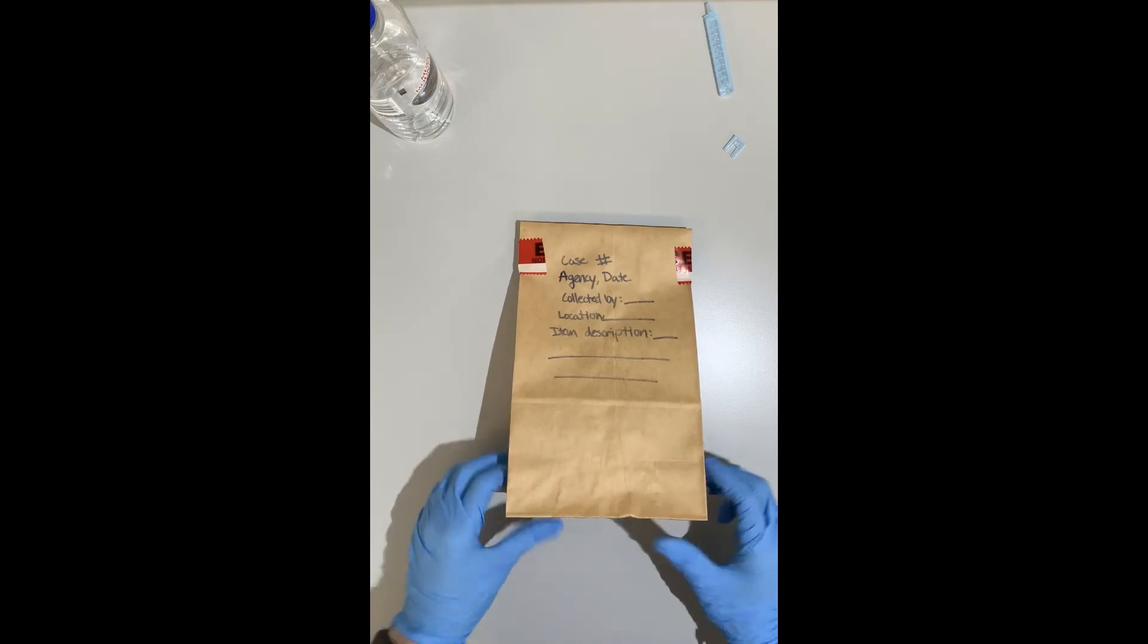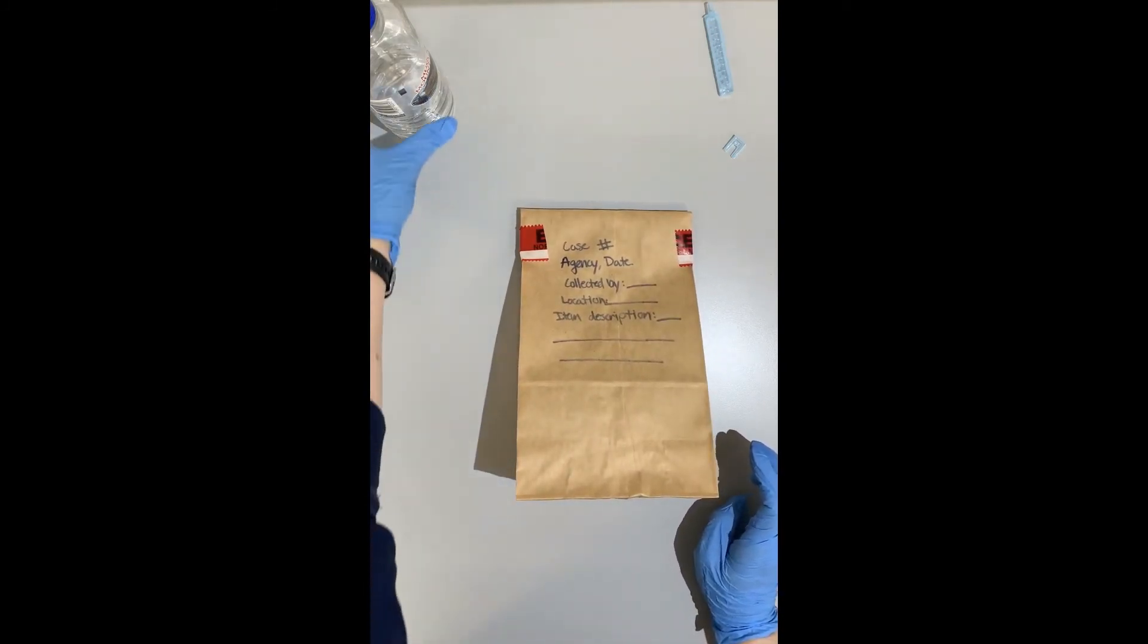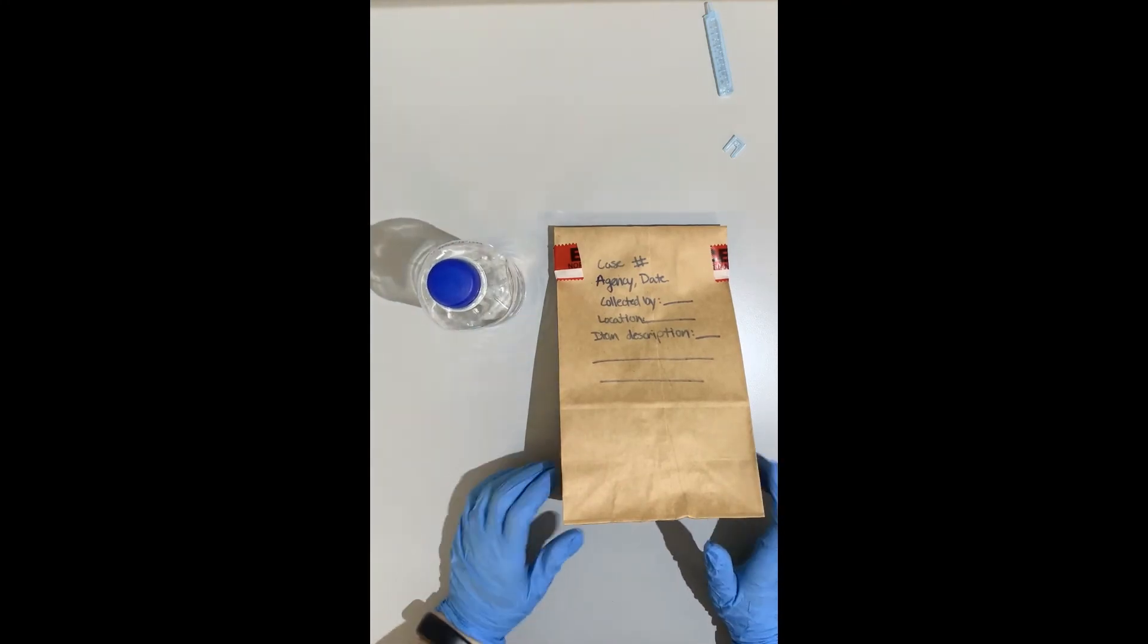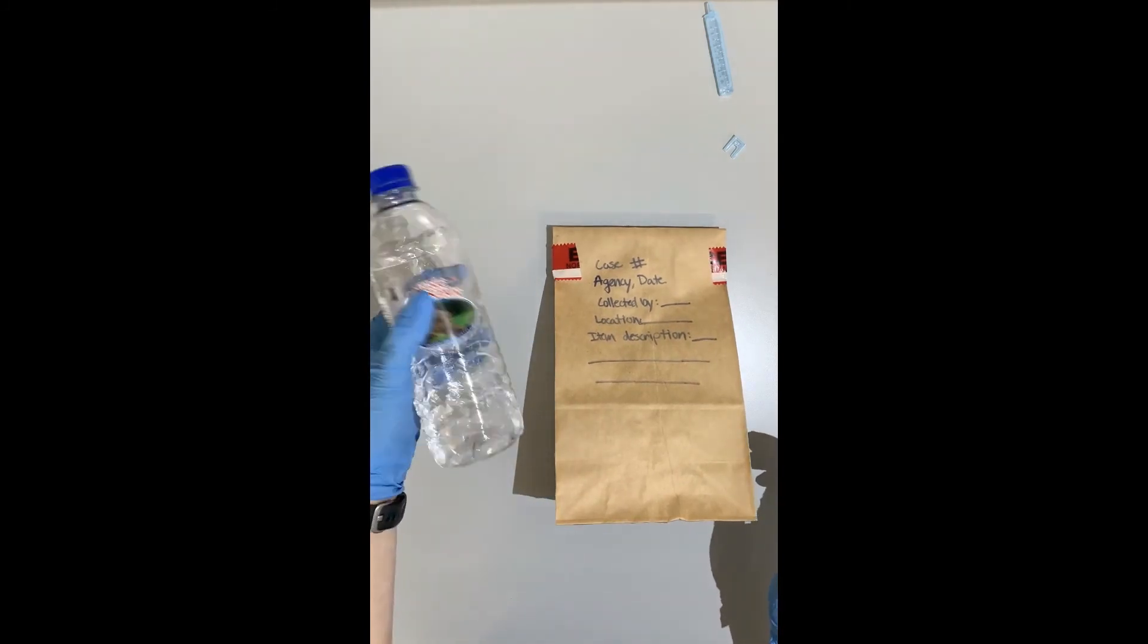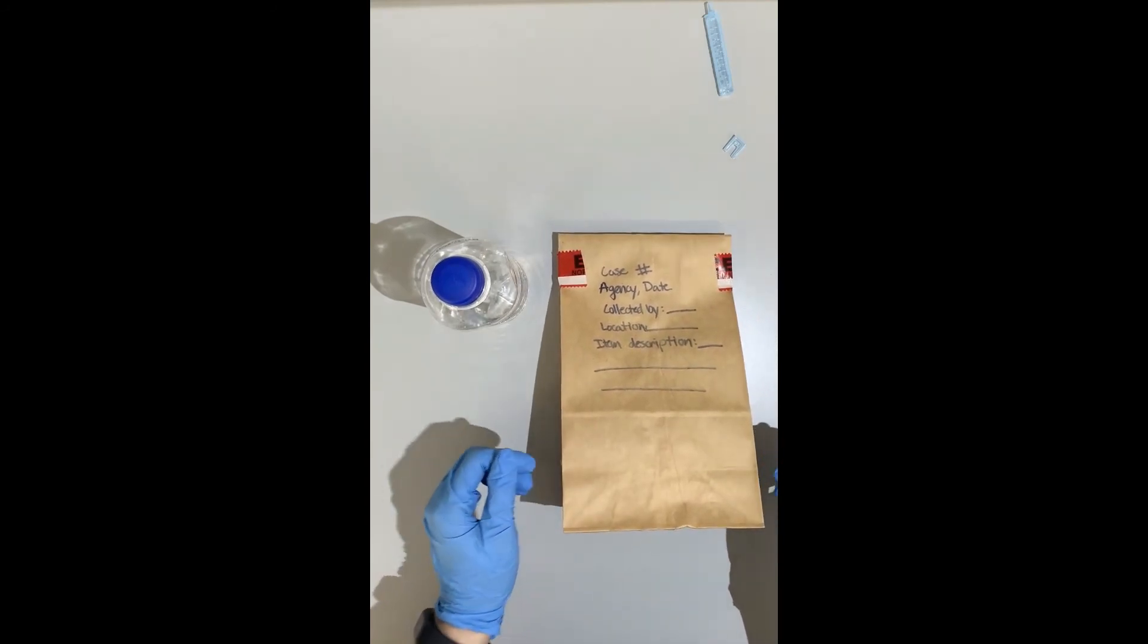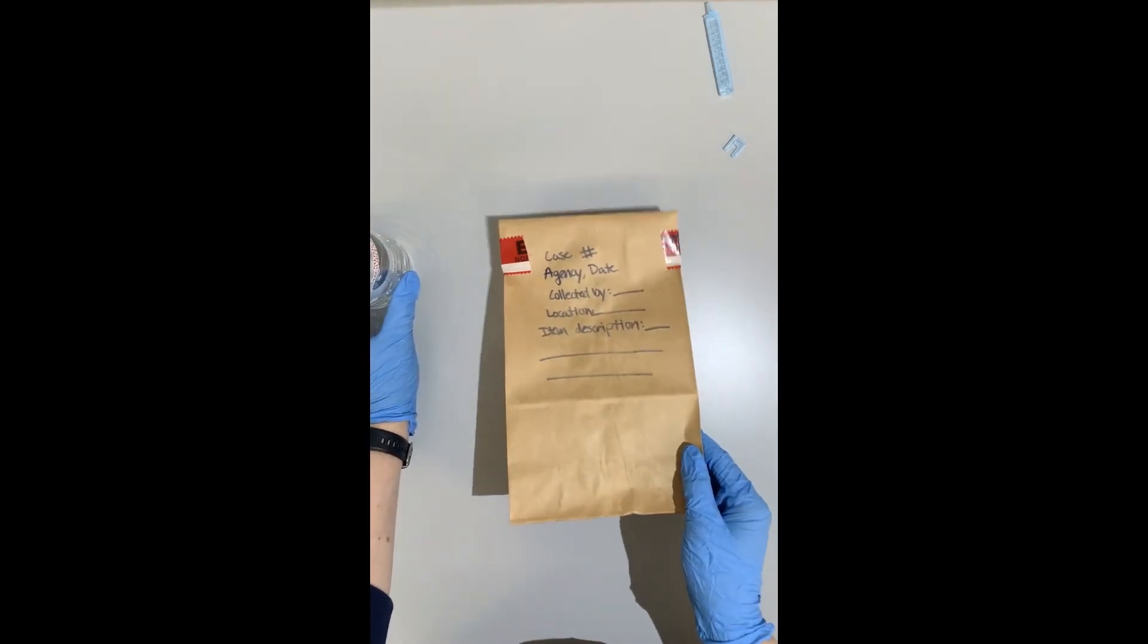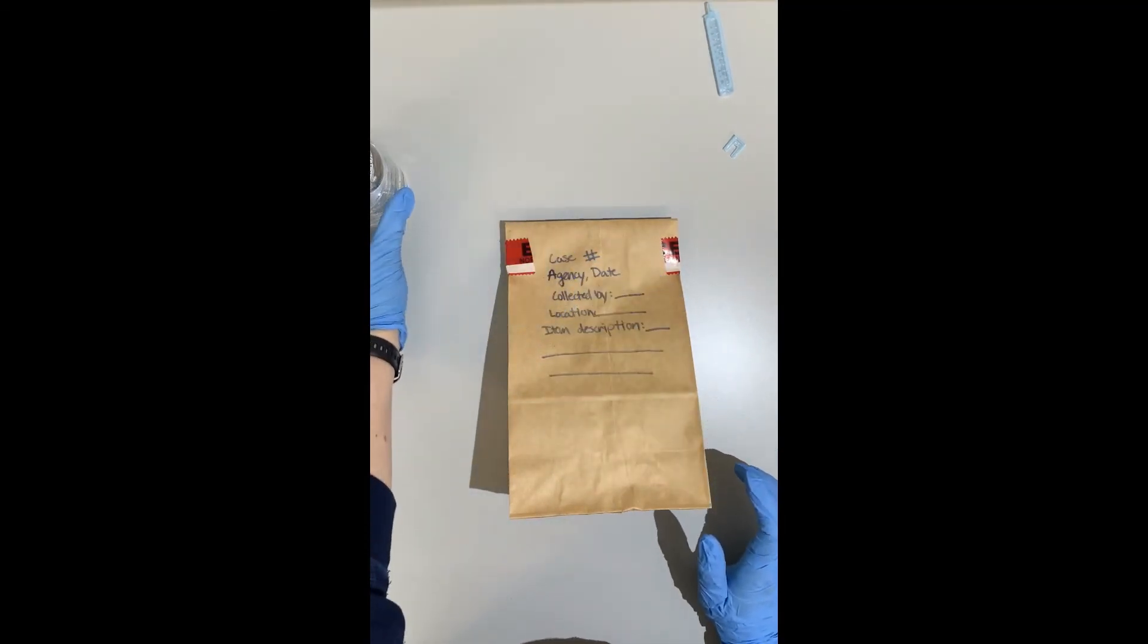And now we have our swab from our water bottle and that way you can still retain the bottle itself that has the liquid in it. However you want to at your agencies is up to you, but that way there's no sloshing and juggling around of a water bottle in transit from your car to the crime lab into the crime lab storage locker to the analyst desk. So whenever you have liquids, make sure you're swabbing the lip or the bottle cap of an item.